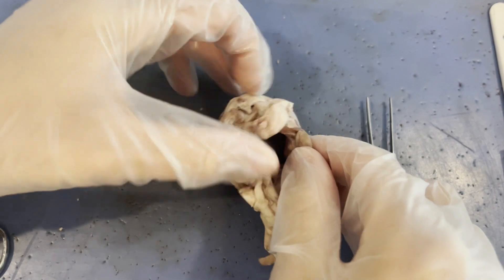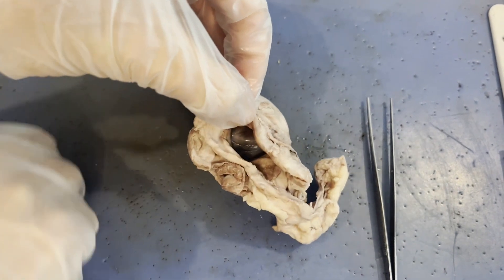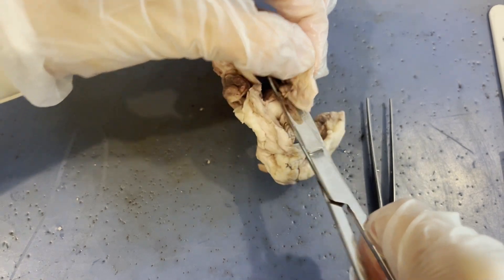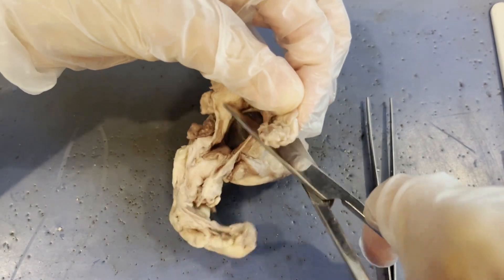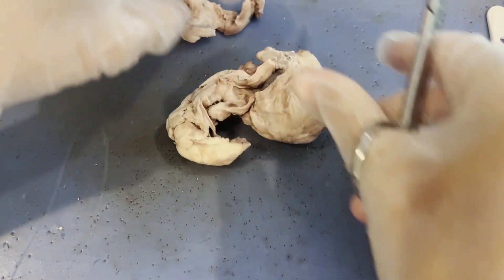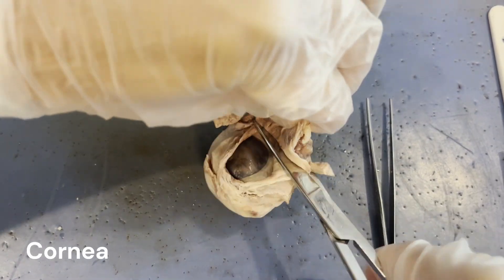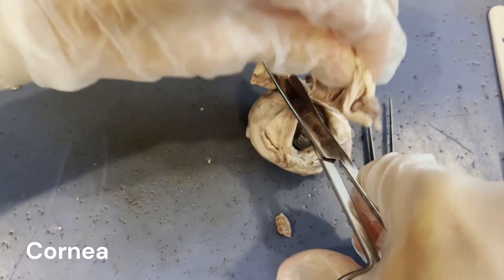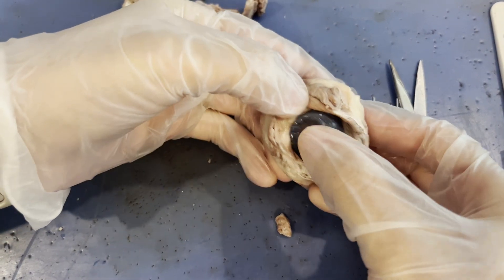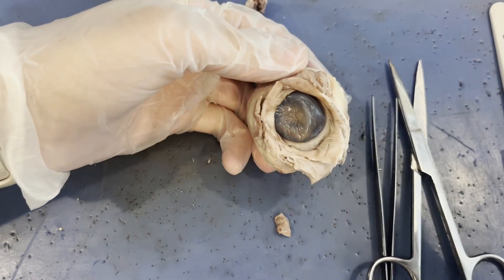Because there is so much extra adipose tissue and muscle tissue, I'm going to cut a good bit of this fat tissue and muscle tissue off so that we can really see the cornea. This structure that you are looking at right here is the cornea of the cow's eye — the front of the cow's eye. It's almost like a window into the cow's eye, and behind the cornea there's the pupil, and I can feel the lens in there.